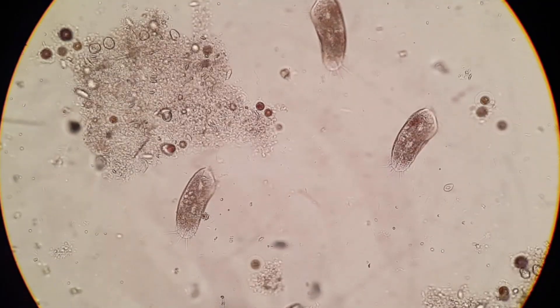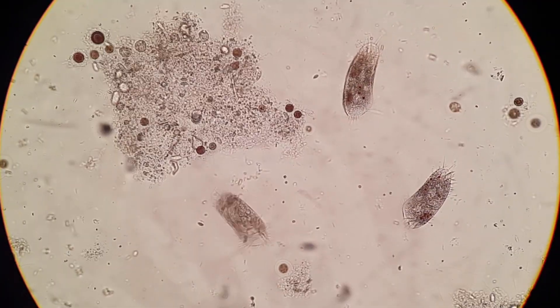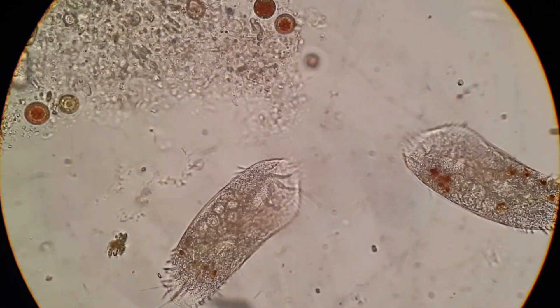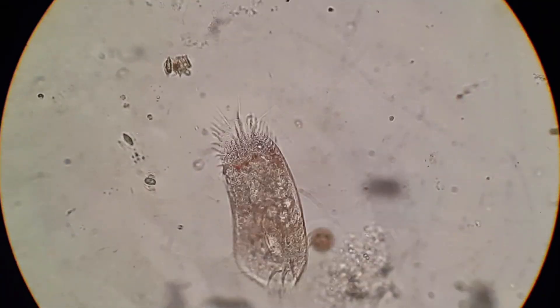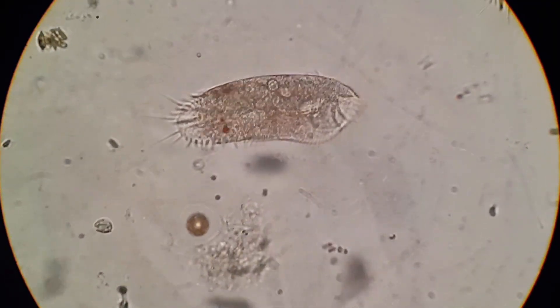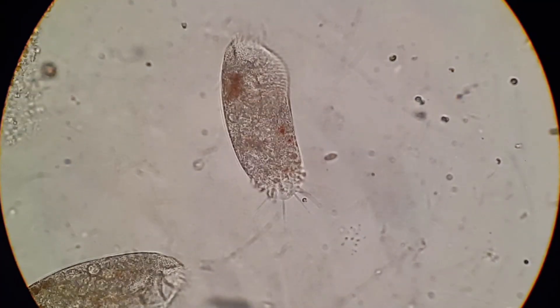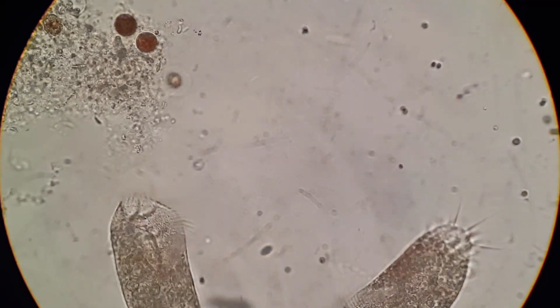Here, at 400 times magnification, we have some ciliates that at first glance might look like paramecia, but are actually — to the best of my knowledge, James Weiss if you're watching please correct me if I'm wrong — spirotrix. Like other ciliates they have cilia, tiny hair-like structures used for motion. What makes spirotrix special is that they also have organelles called cirri, which are the longer-looking hairs you can see on their front and back end — they are a bundle of many cilia together. Like cilia they are used for swimming and food capture, but unlike cilia they can function as tiny feet, allowing the spirotrix to crawl over surfaces.